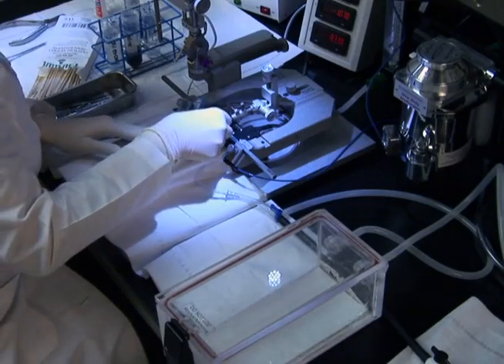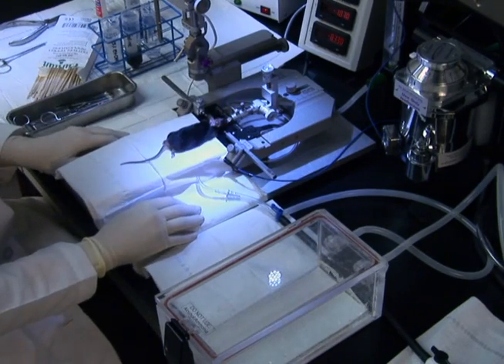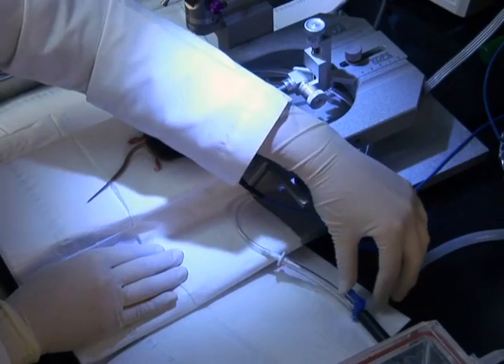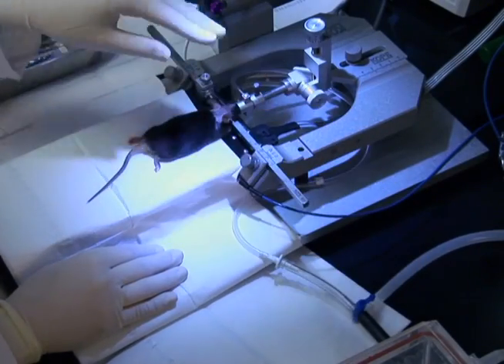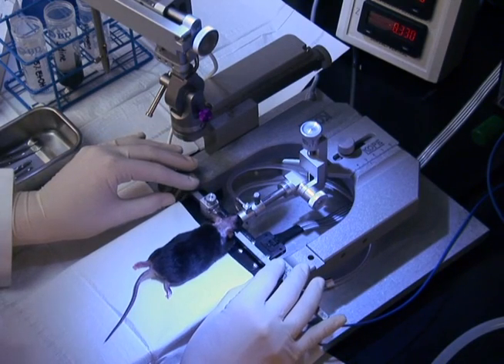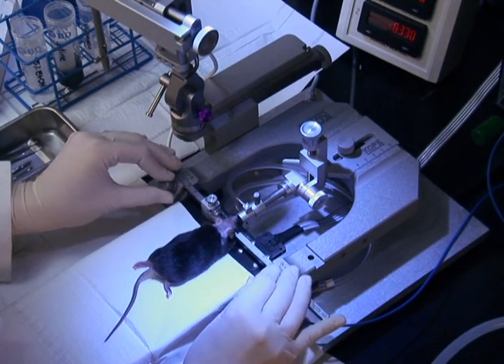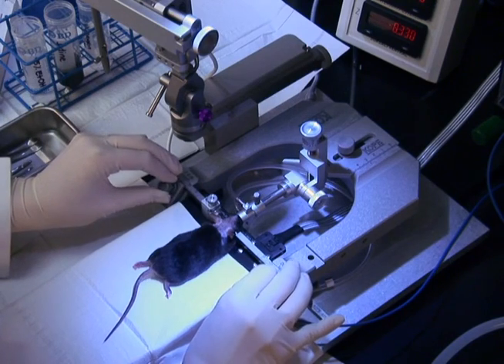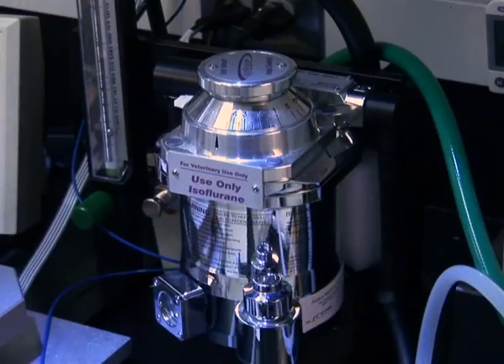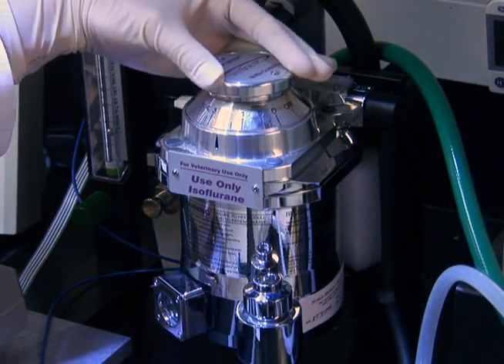Then, carefully and gently place the anesthetized mouse on the stereotaxe. Push the nose cone over the nose and direct the gas flow to the stereotaxe to keep the mouse anesthetized. Secure the head with the ear bars. Leveling ear bars are used here, though to target the lateral ventricle, a perfectly level skull is not necessary due to the large size of the ventricle. Turn the isoflurane level down to 2% for maintenance of anesthesia.